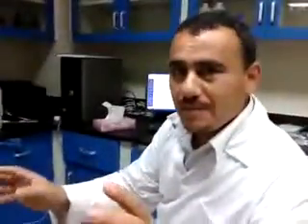With the auto-sampler, you can stay at your chair doing your work during sample collection. But now I can't stay — I should stand here every five minutes to change the sample, then five minutes, change the sample again. Between changing samples I should wash for 30 to 40 seconds. Now if you see here, come here — it is self-measuring, acquiring data.